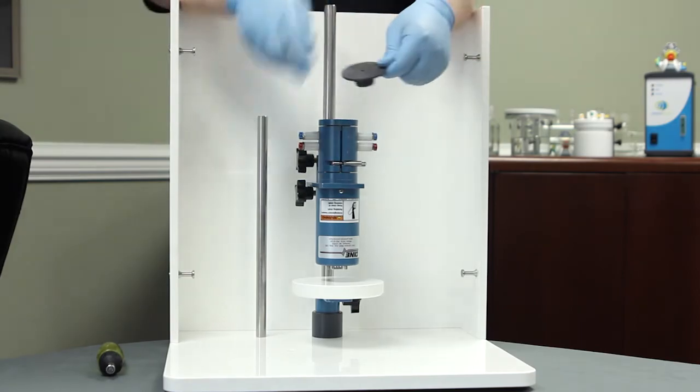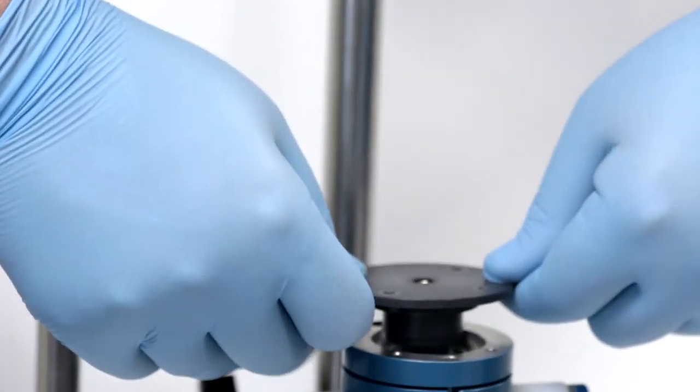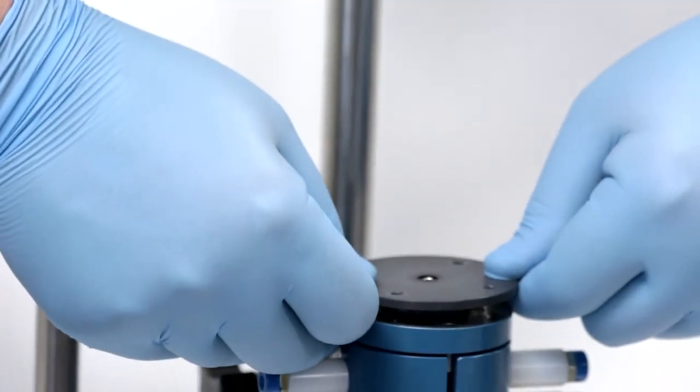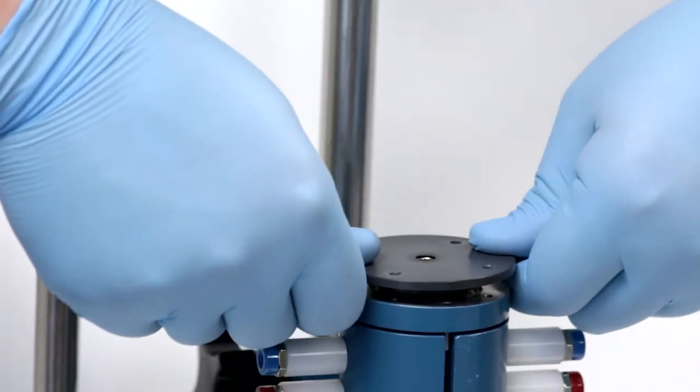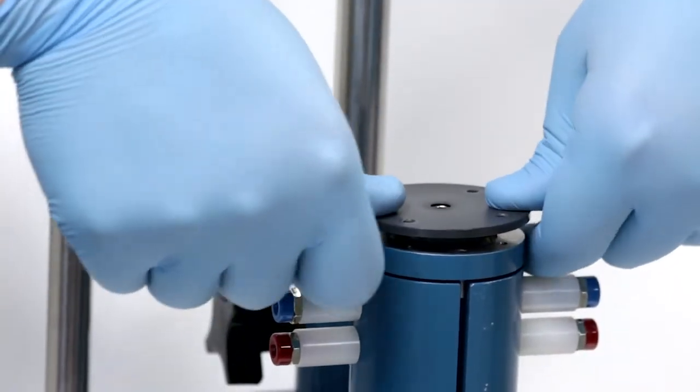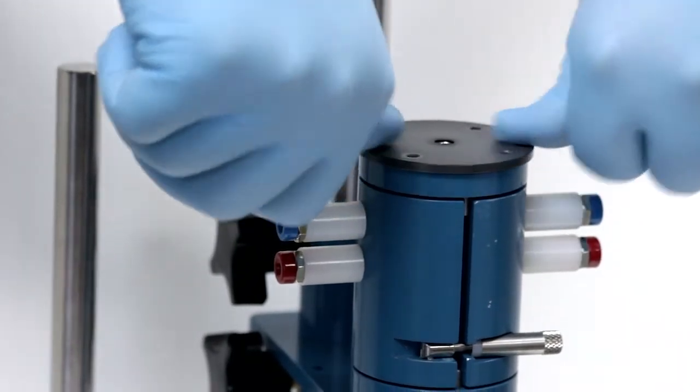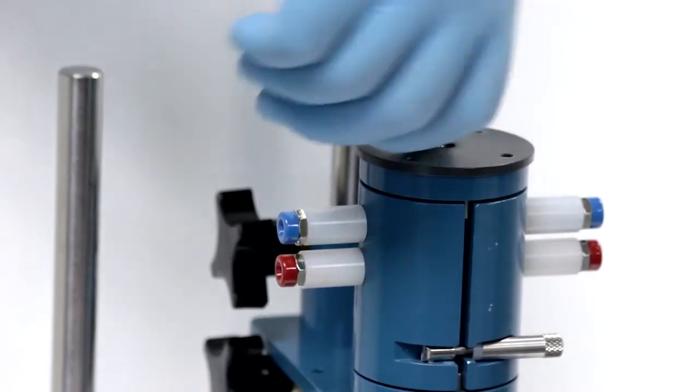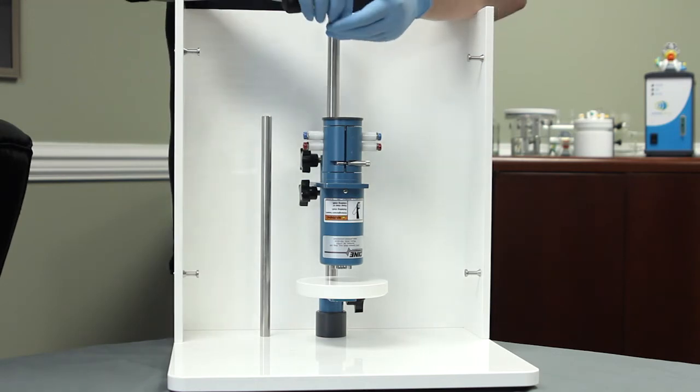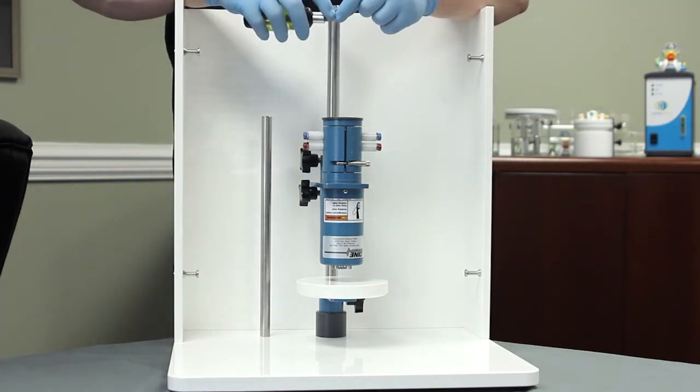I like to come in and get a top-down view and carefully align the holes and threads and then apply some pressure, a little bit of back and forth pressure to get the bearing assembly flush with the bottom. Now all that's left to do is replace the four screws.